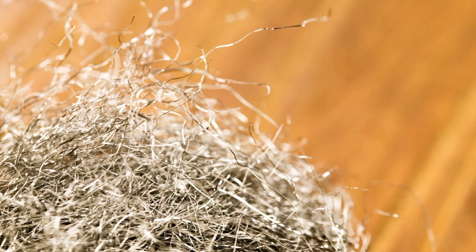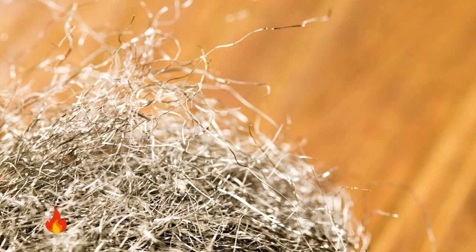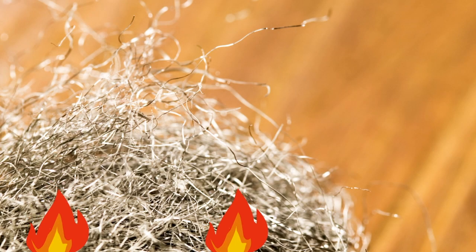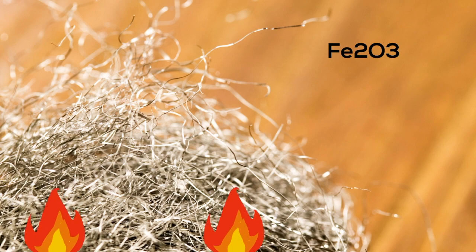Steel wool is made mostly of the element iron. When the steel wool is heated, the thin strands have a large amount of surface area, which allows the iron in the steel wool to burn and combine with the oxygen in the air. This accelerated oxidation is rusting.